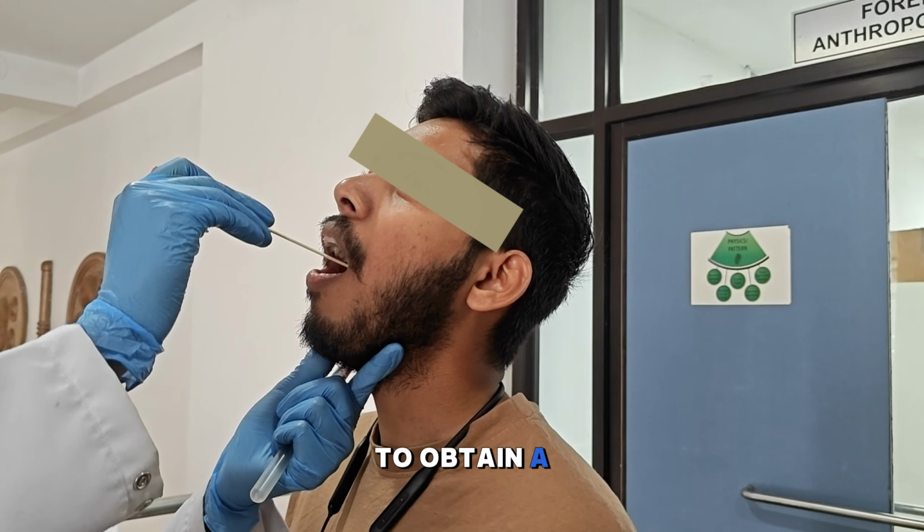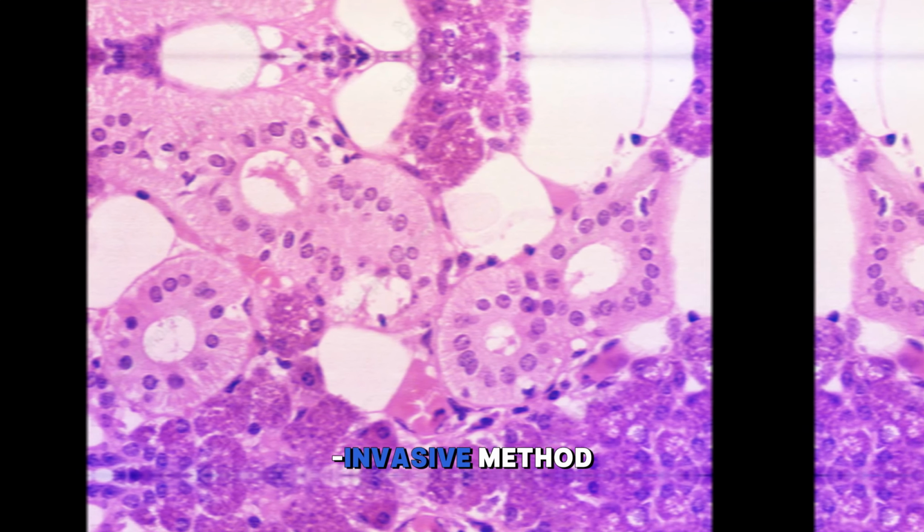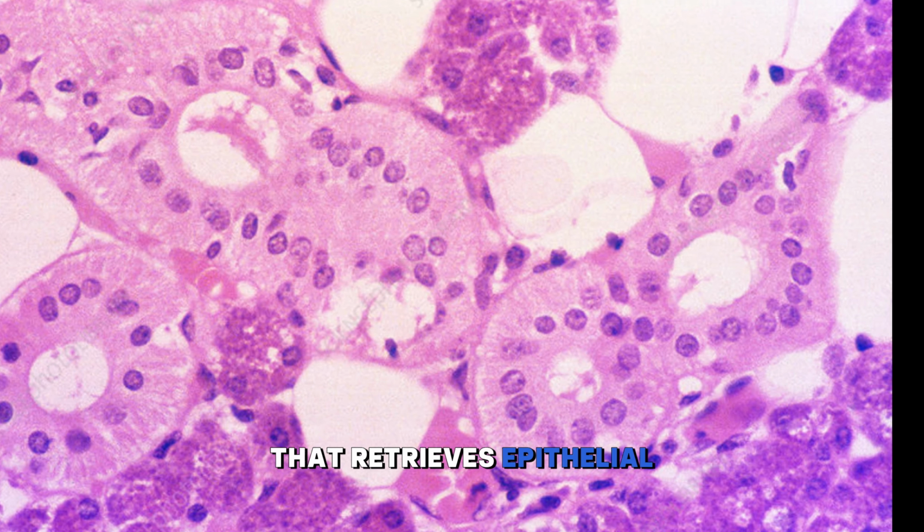To obtain a known DNA standard, a buccal swab is collected, a simple non-invasive method that retrieves epithelial cells from the inner cheek.